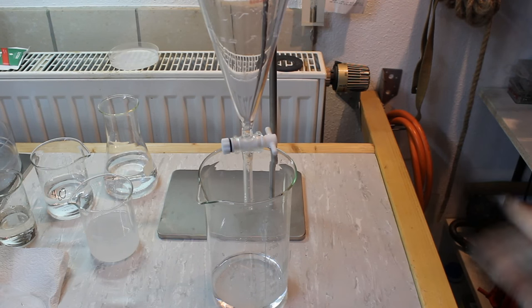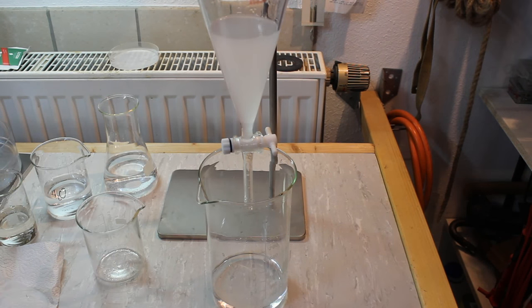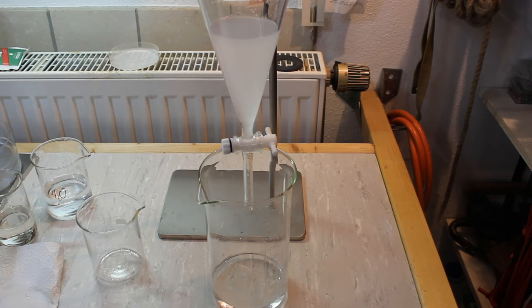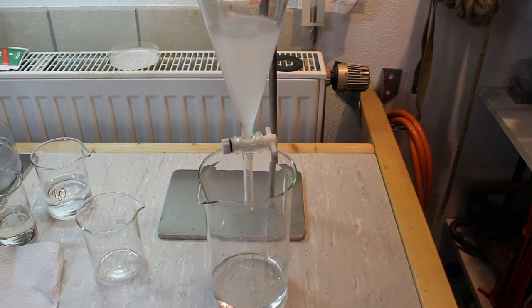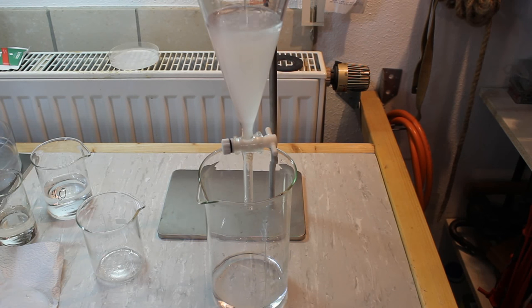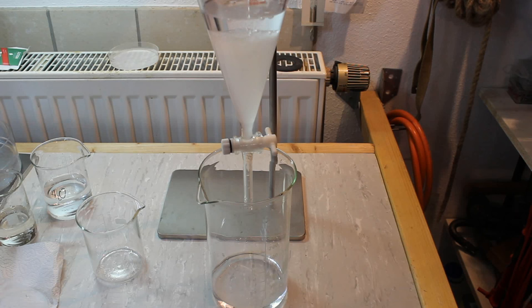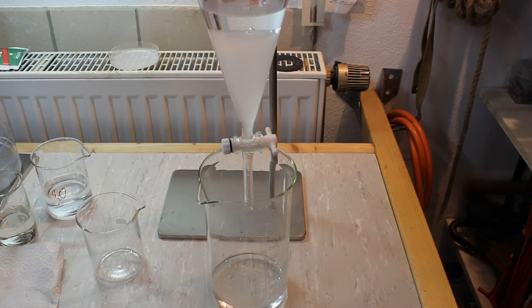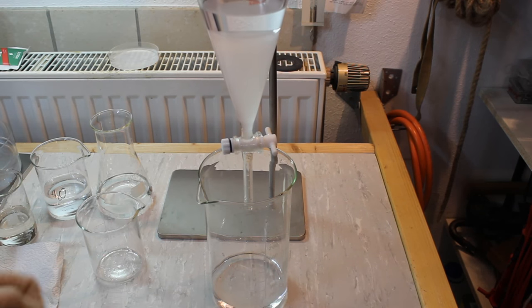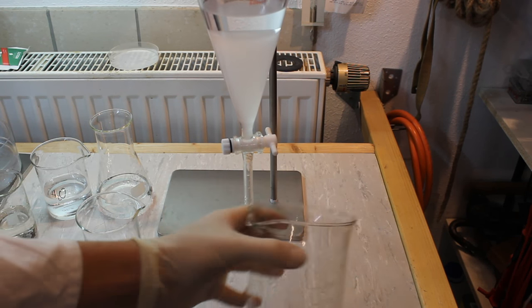Now I close the stopcock and add our organic layer back into the top. There is still some acid in our organic layer so we're going to neutralize it with a concentrated solution of baking soda. The baking soda layer will be the top one. Cap it, shake it, and vent it — but vent it very often, since if there is some acid present it will form carbon dioxide, so be sure to vent it very often.